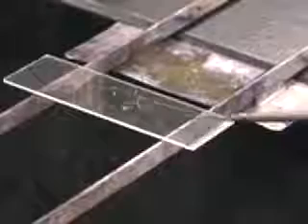Then you'll mix your culture with your drop of water. Try and create a thin film on the slide surface by mixing the culture and the water.